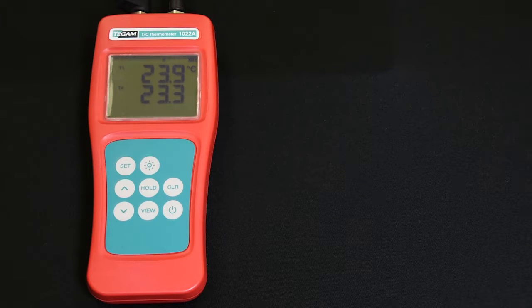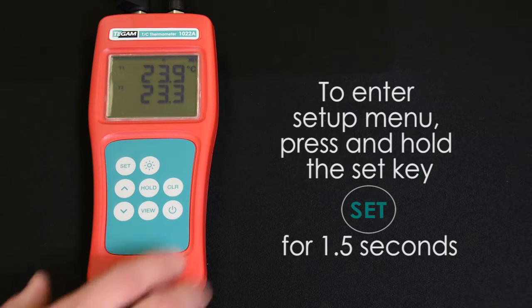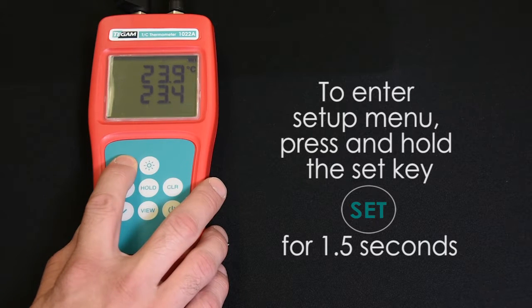Settings are found inside the setup menu. To enter the setup menu, press and hold the set key for about 1.5 seconds.